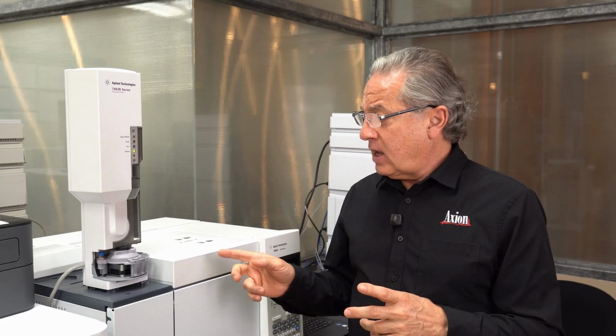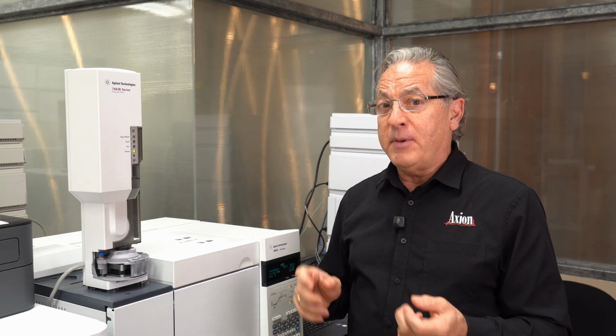So watch me hop into this GC. We're going to pull out the liner, put in a new one, the column, drop in a new gold seal, and it's going to fix the problem. So what I'm going to do is pull out the liner and drop in a new one.